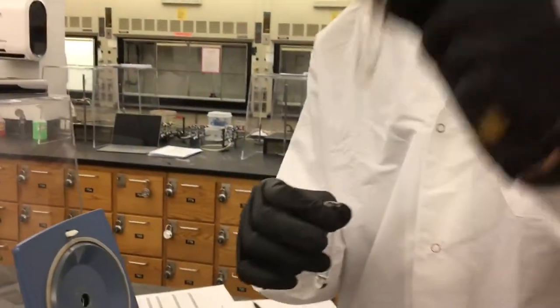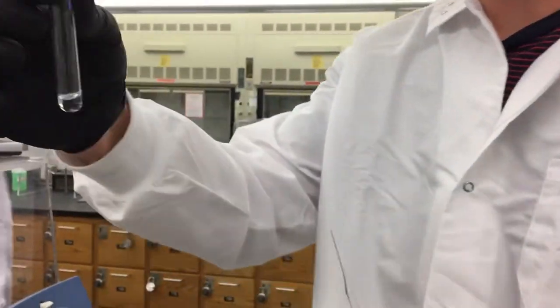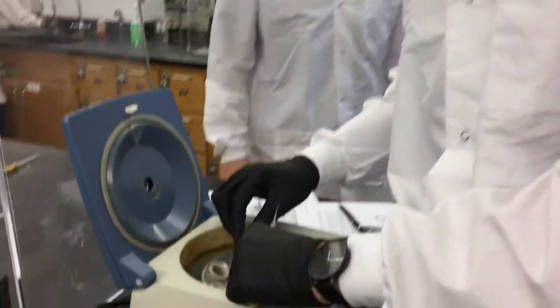So here we have whatever we're centrifuging. Here there's some sand in there. And then a counterbalance, and you're going to place them opposite one another.